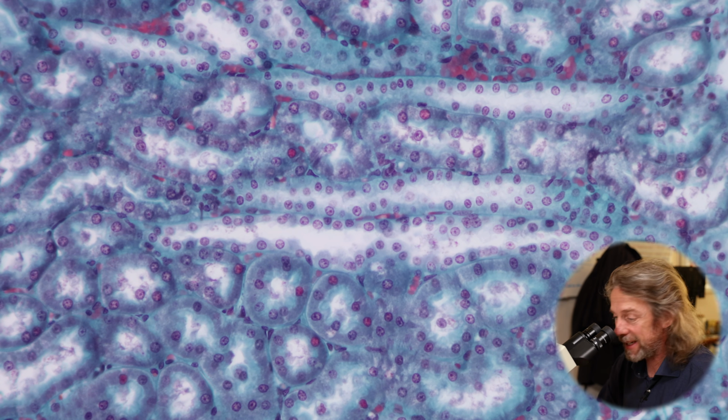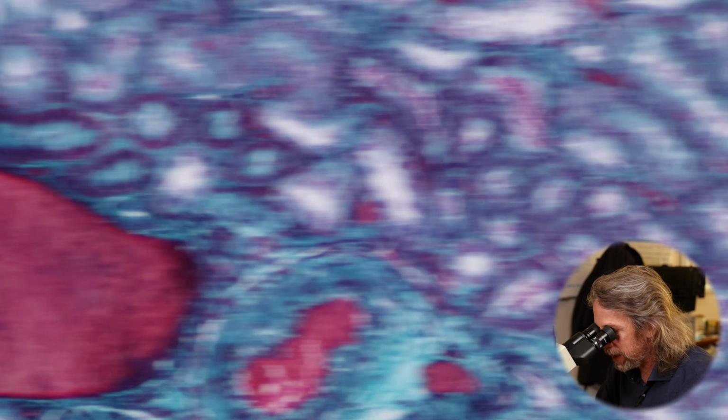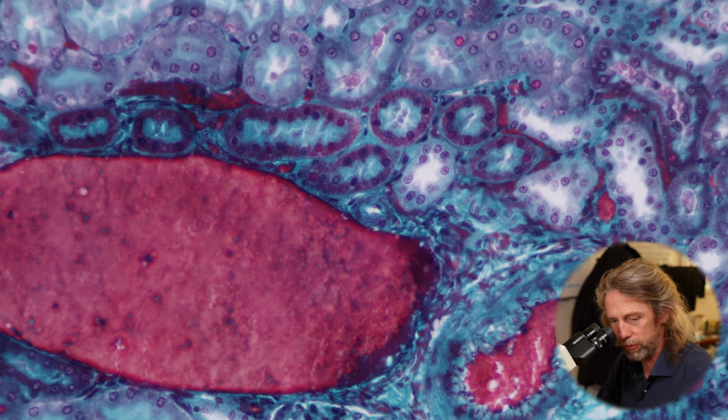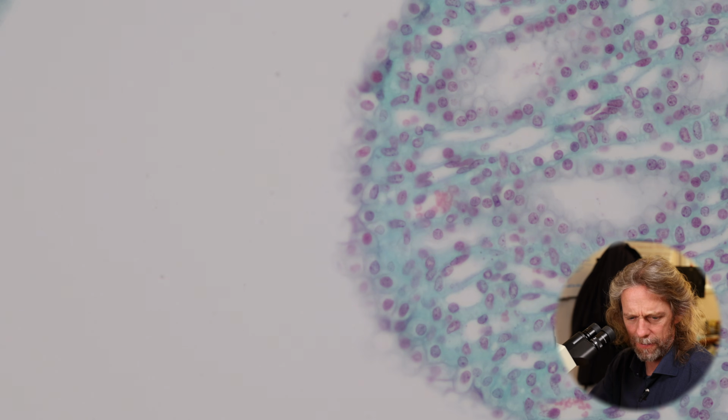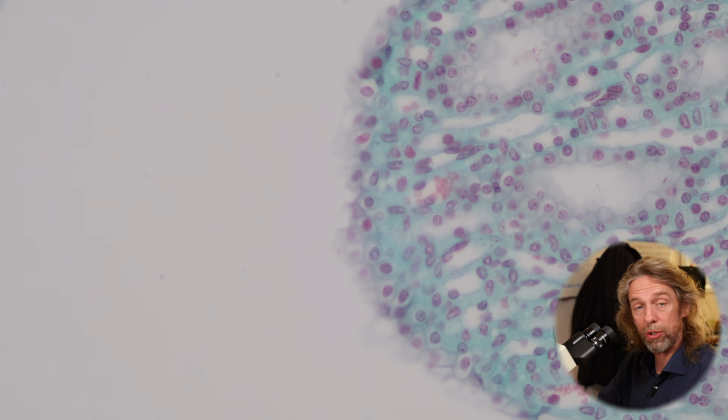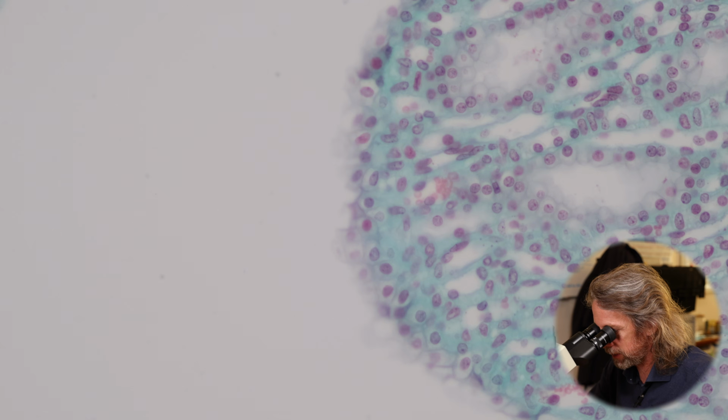And the collecting duct then takes the urine back down, wee down. Oh, those blood vessels, those are cool. Past those, down into the medulla, and all the way down to the tip where urine is deposited into the calyx. That's it. Just do that a million times over and you've got a functioning kidney.